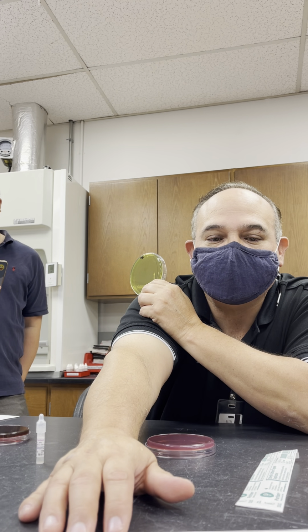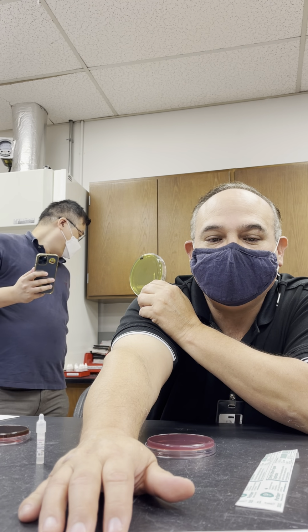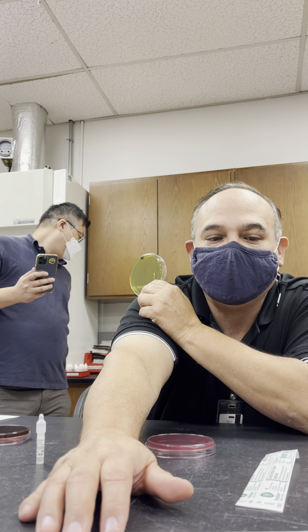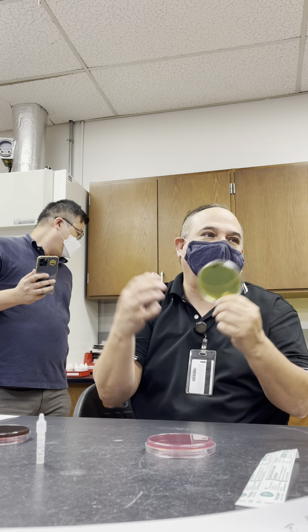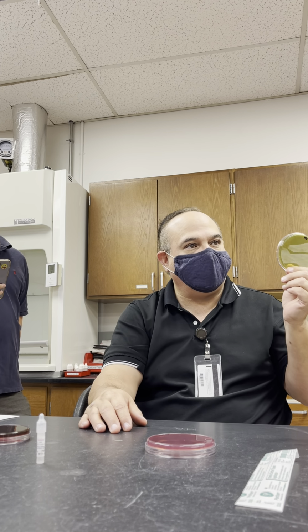Proteus mirabilis, and E. coli, Salmonella, and Enterococcus faecalis. Enterococcus faecalis is gram-positive. Cynthia, is it going to grow on here? No. Right? We put it on there just so that you can see that it's going to inhibit them.